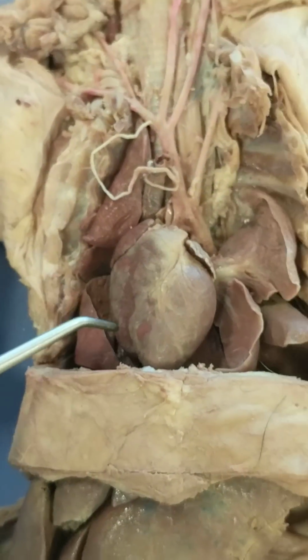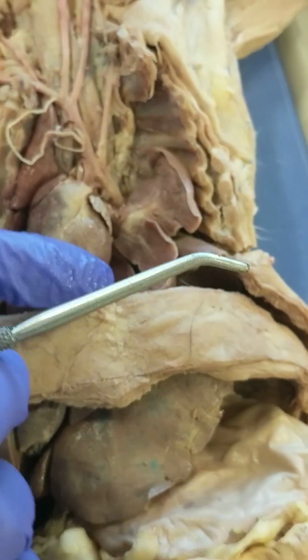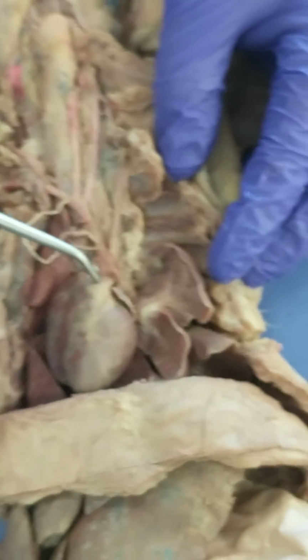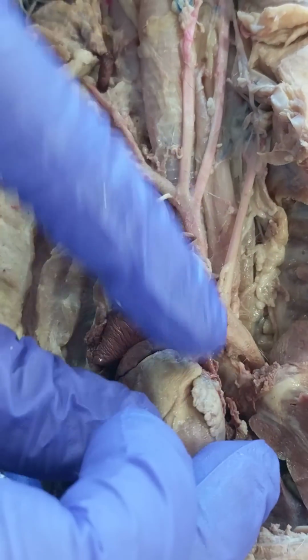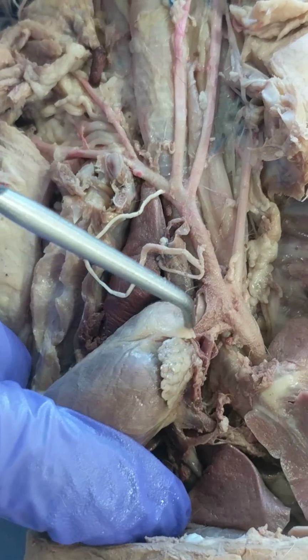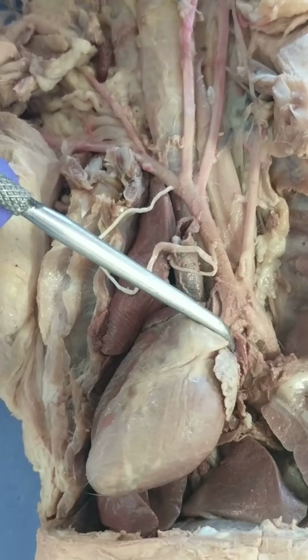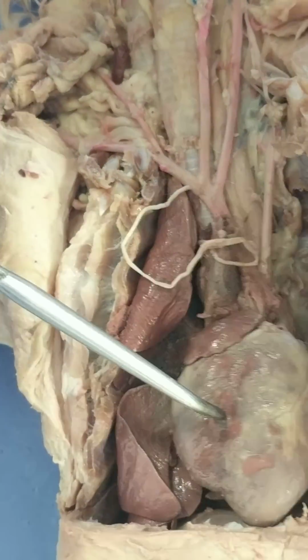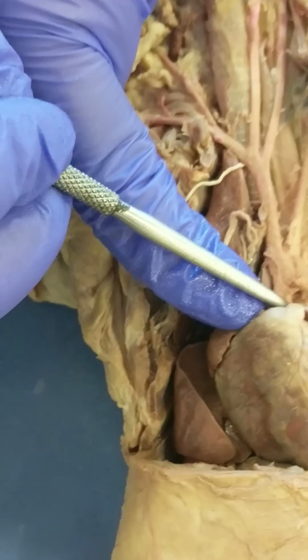And leading from the right ventricle is the pulmonary artery. You can kind of tell the pulmonary trunk is starting right there. And I eviscerated it a little bit, looking for the connection to the lungs. So you won't probably be asked on this cat, but this would be the pulmonary artery right here.